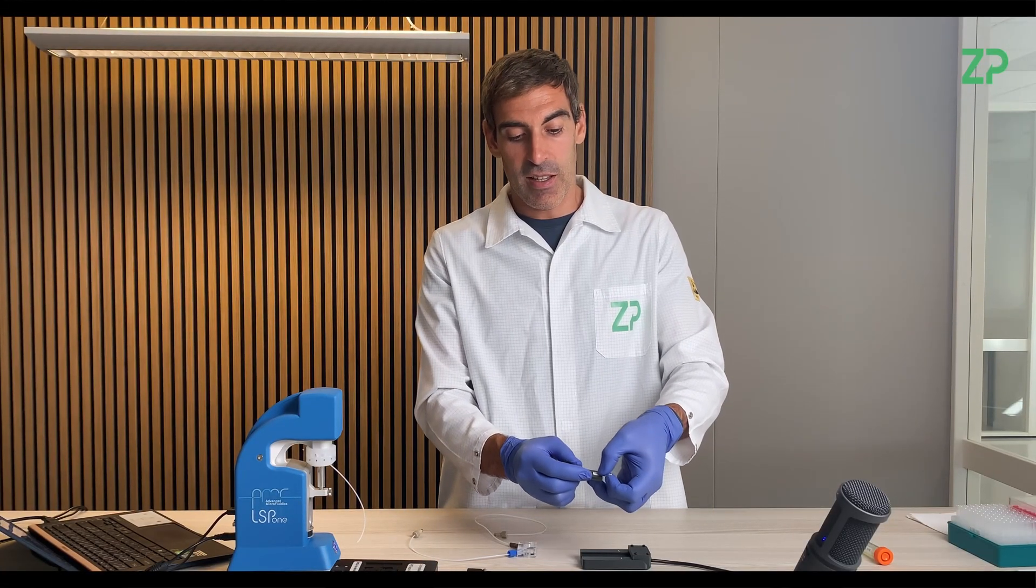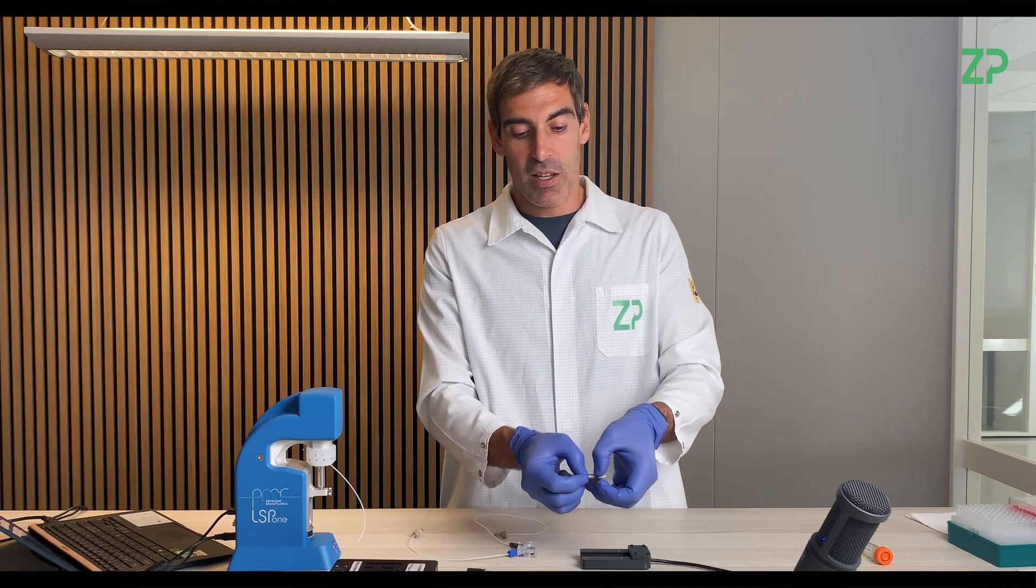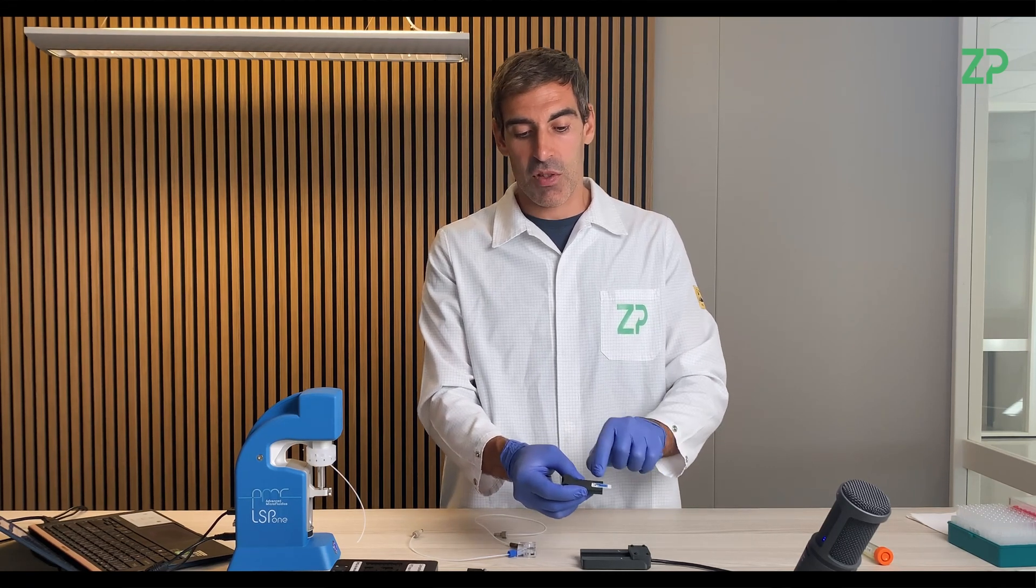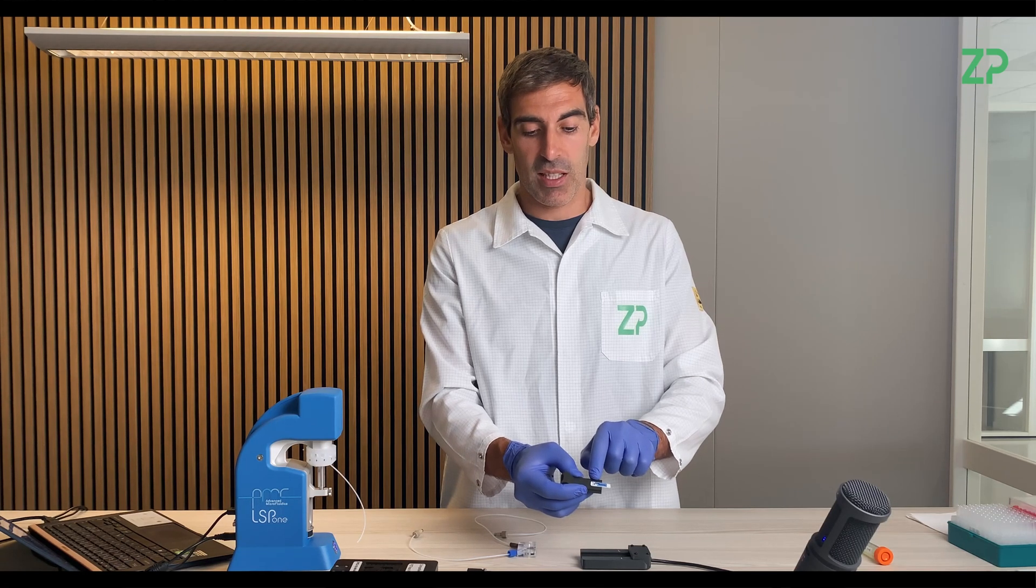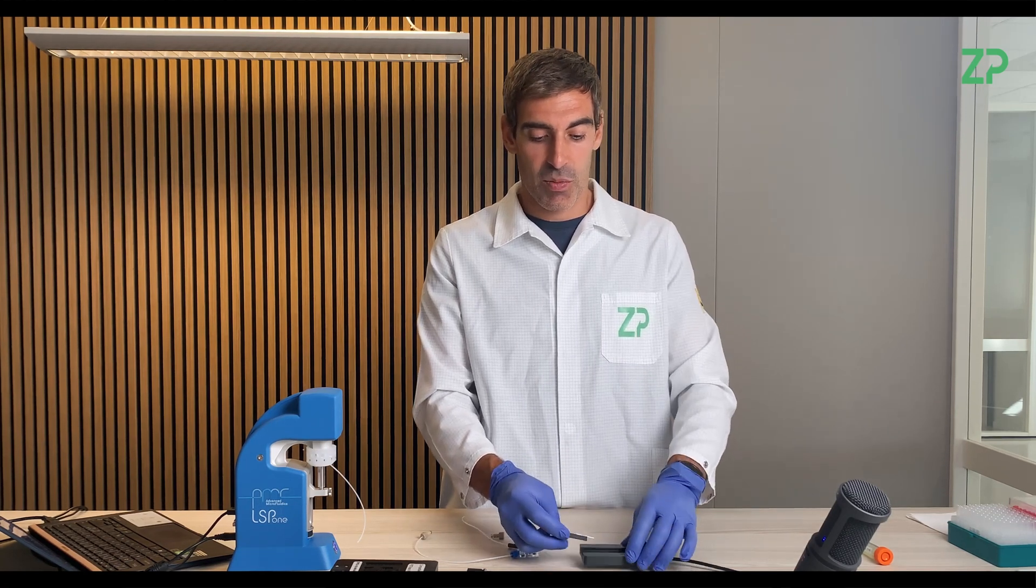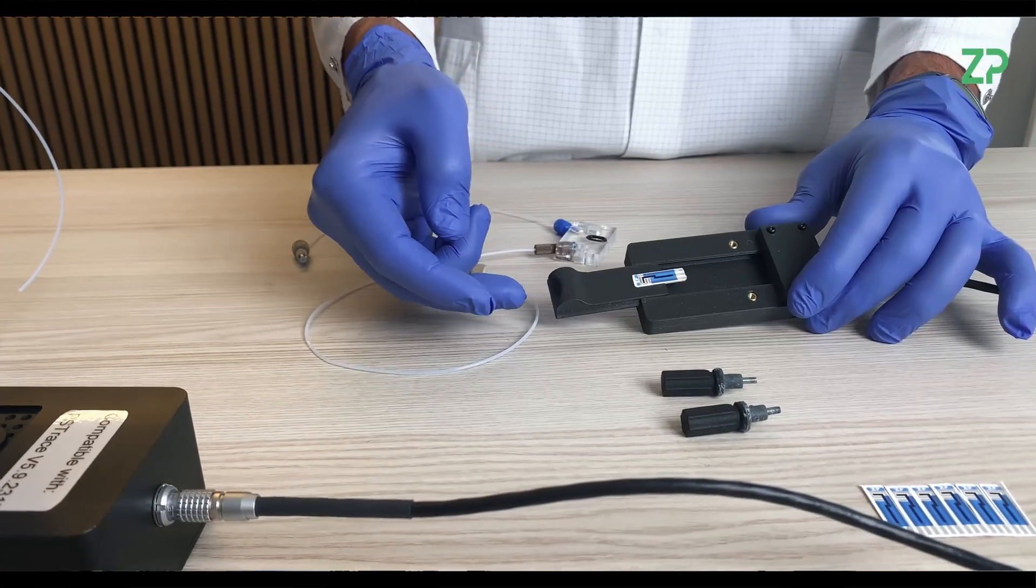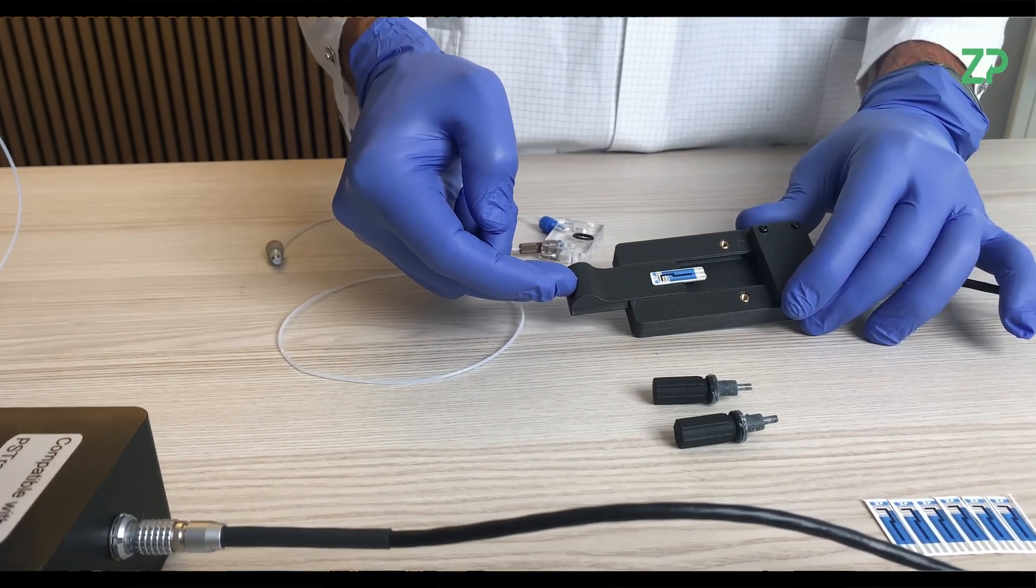What you have to do is take one of these sensors and basically insert it into the sensor holder. You have to be a bit careful, use gloves, and should not touch the electrodes, the screen printed electrodes, because they of course might contain formulations.